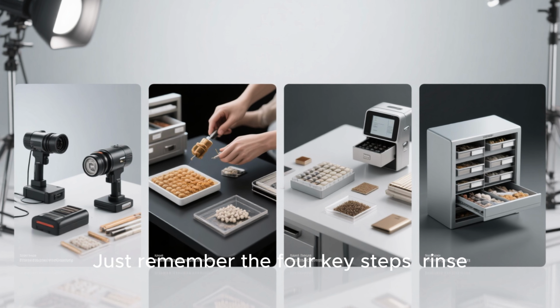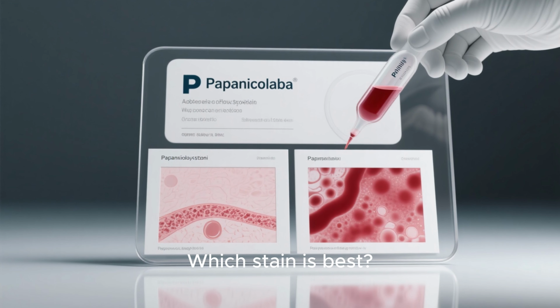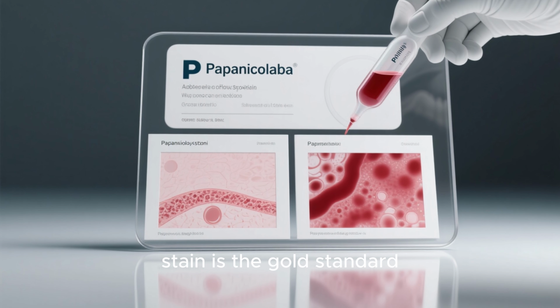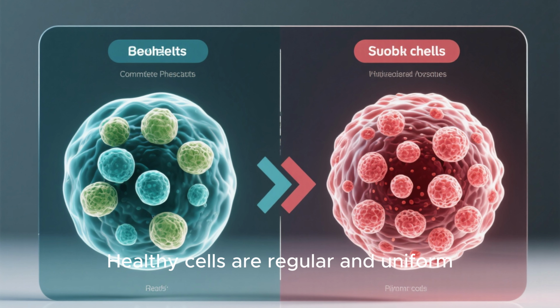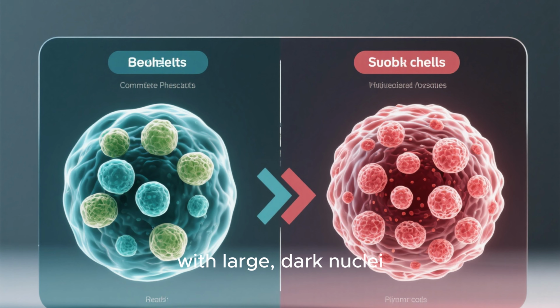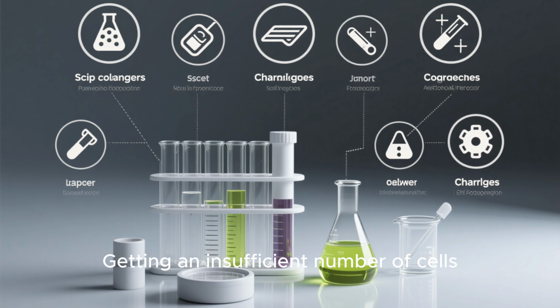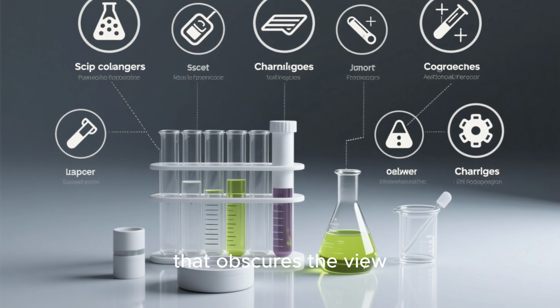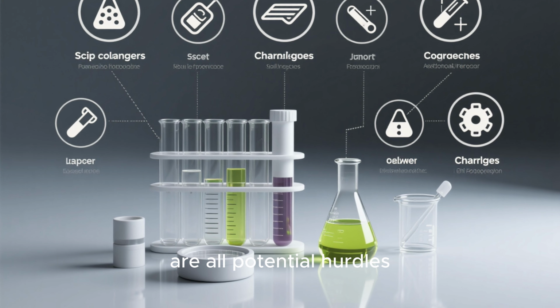Just remember the 4 key steps: rinse, scrape, transfer, and fix. Which stain is best? For detailed cytology, the Papanicolaou stain is the gold standard. And how do you tell the cells apart? Healthy cells are regular and uniform, while abnormal cells are often irregular, with large, dark nuclei. Are there any challenges? Absolutely. Getting an insufficient number of cells, dealing with a lot of inflammation that obscures the view, making staining errors, or misinterpreting the results are all potential hurdles.